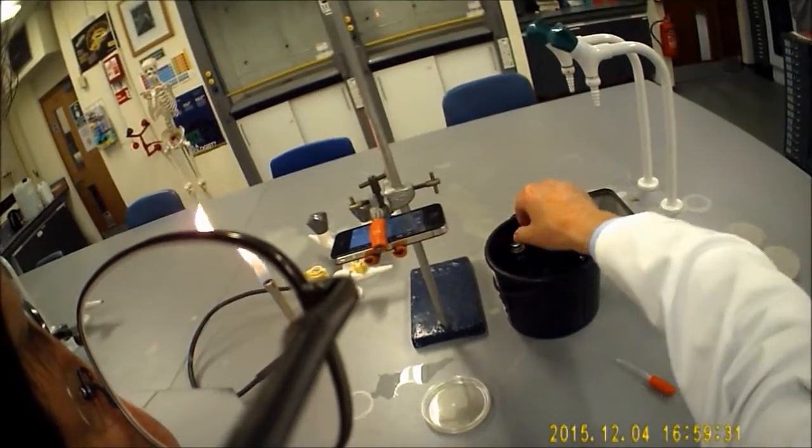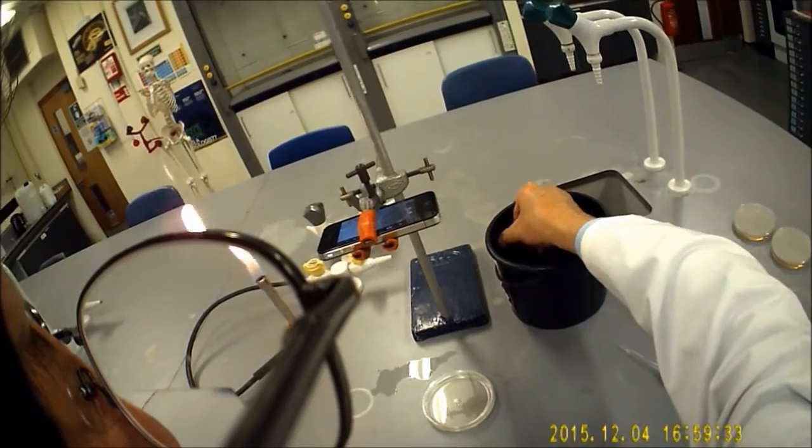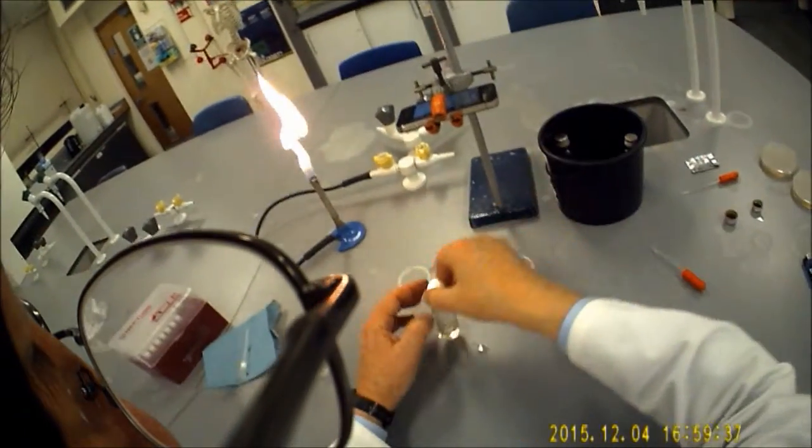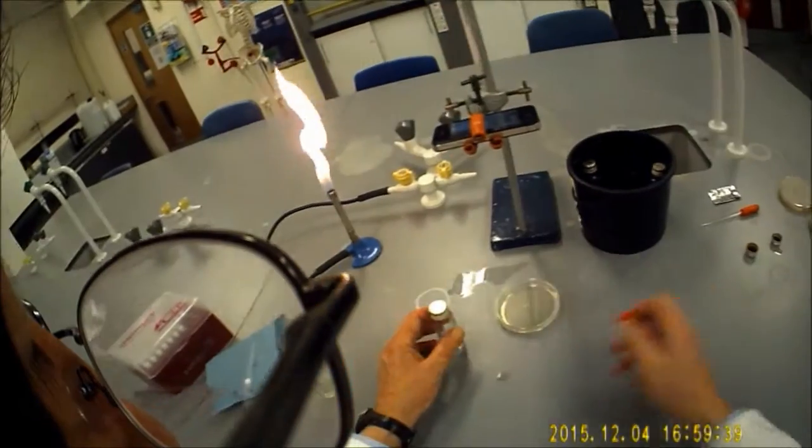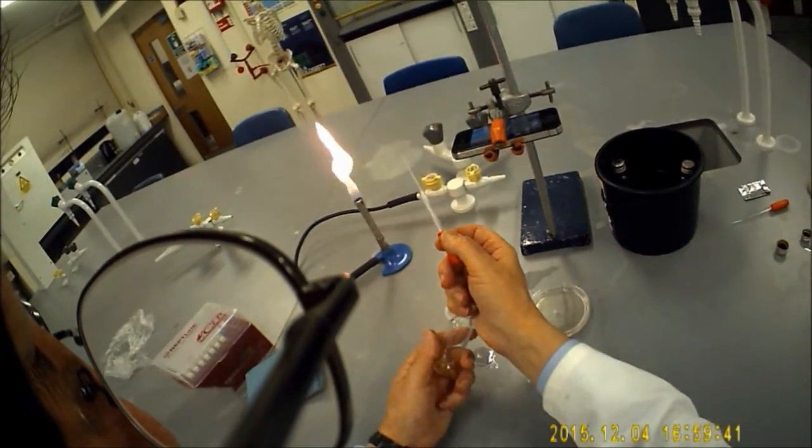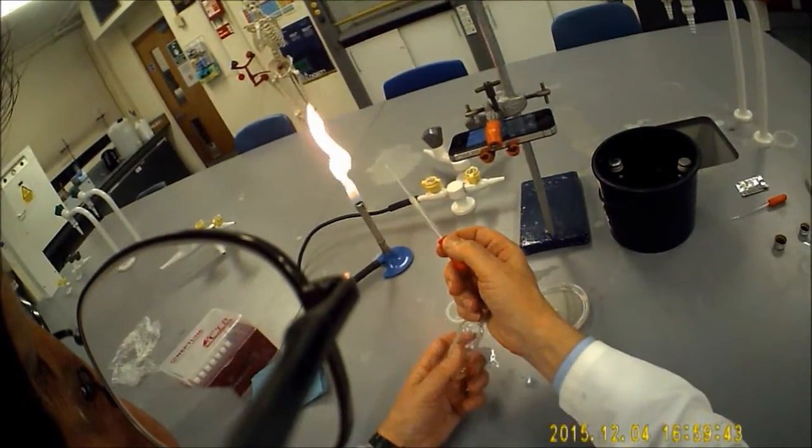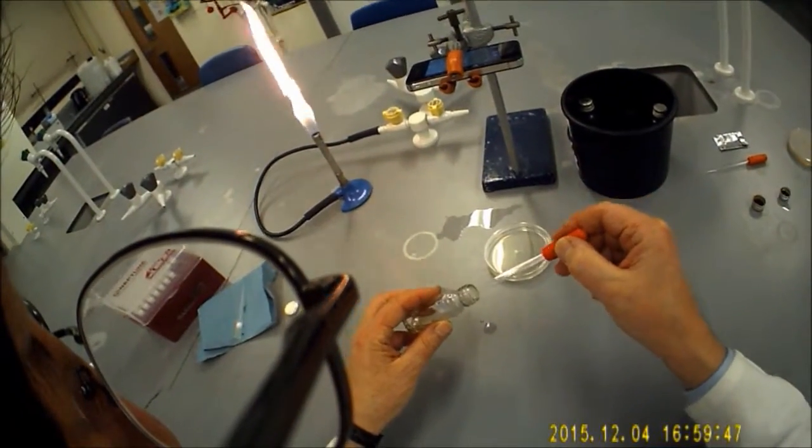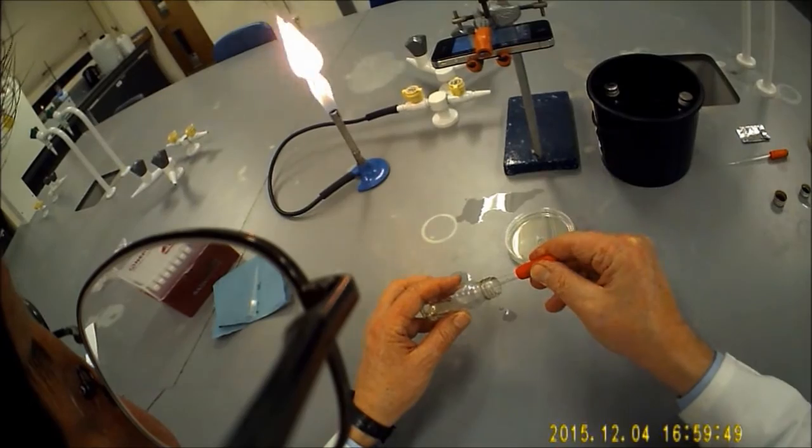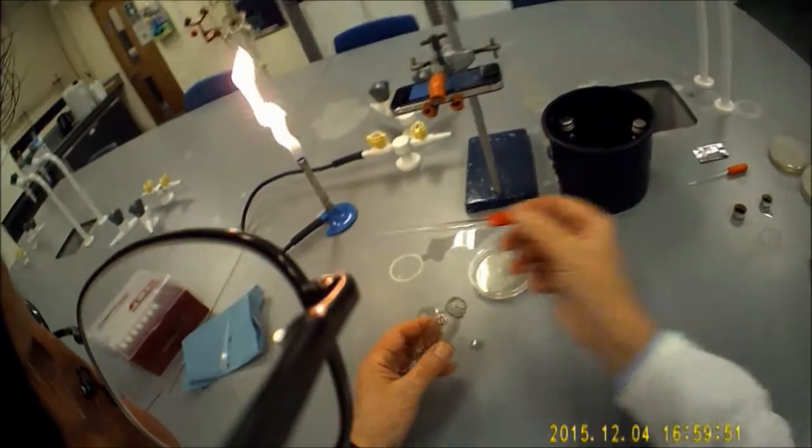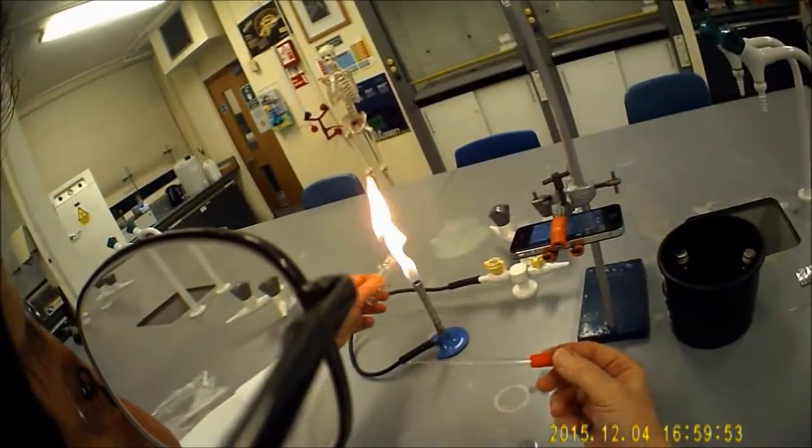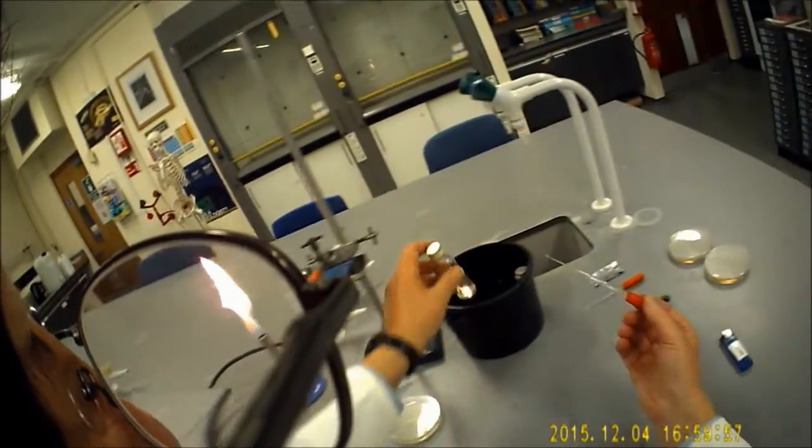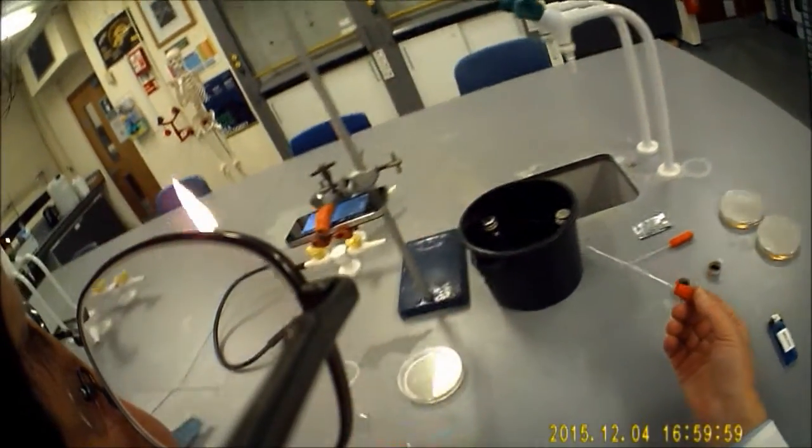So I'm just going to take one of my part-filled bottles that I had left over. You only need a tiny amount. I'm just going to flame the mouth. I'm going to draw up a small amount into the pipette here. We'll flame that again because we'll be using that for some of our other vessels. That goes back into the hot water.